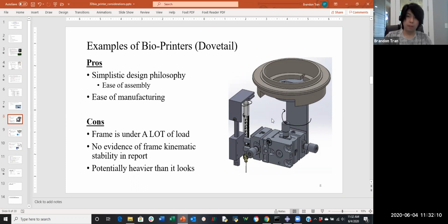And then there are some instances of a potential change in angle happening as this thing is activated. So with the kinematics involved, regardless of whether this thing can handle its shear or not, which was already calculated to be able to handle the loads being applied, kinematically it won't serve a good purpose. You want things to be stable in their designated position. If this thing is turning, you're going to be off by some positions. And if you want finer quality, that might not be the best thing to use as a support.